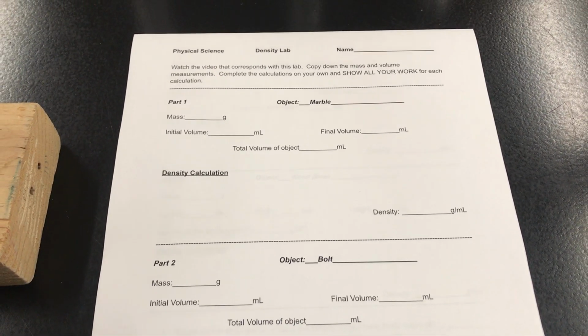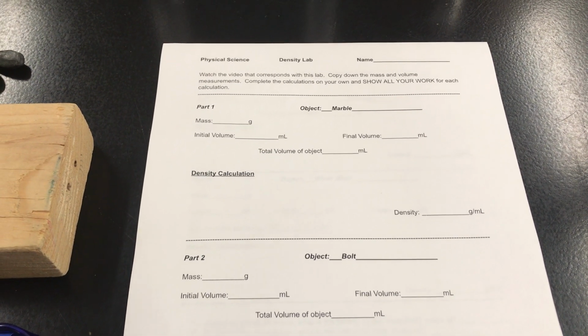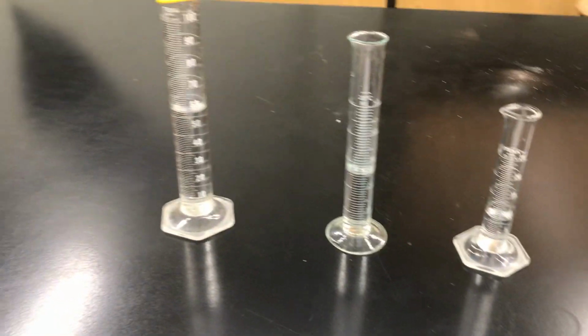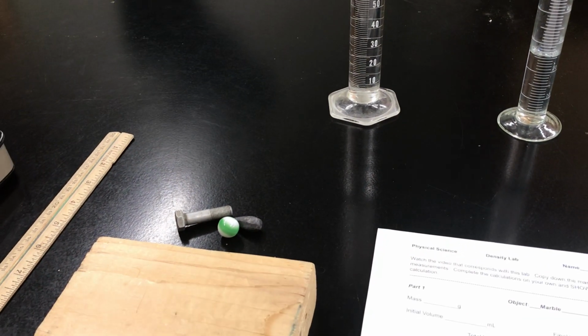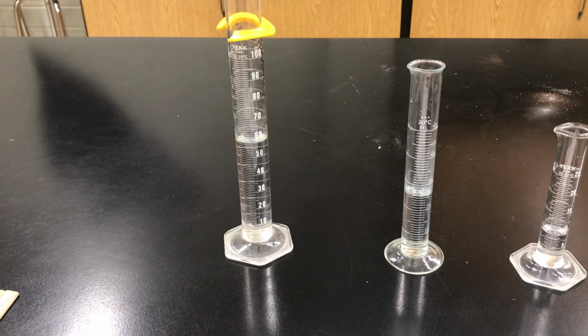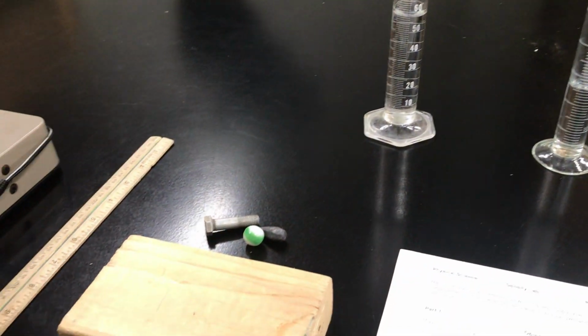Okay, so take a few moments, pause this video, and get all your stuff ready. You're going to need something to write with, and you're going to need a calculator to do this activity. Okay, so after that happens, come back, start the video up again, and we're going to walk you through some things here where you're going to be taking some measurements and hopefully getting an idea of what would happen. Normally we'd be doing this together in a lab, but since we're not here, we're going to be able to do this virtually. All right, so we've got 4 objects here.